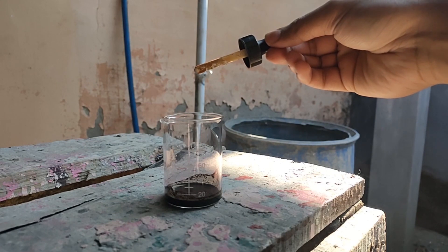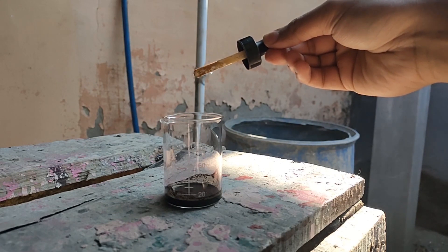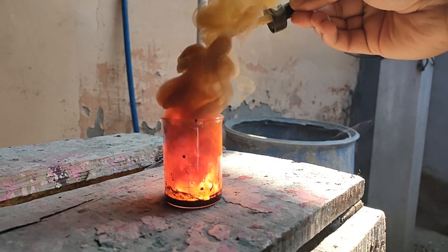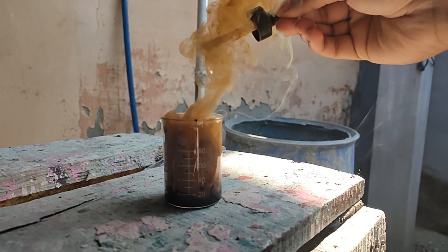As soon as the drop of alcohol falls into the mixture, the mixture explodes — and the explosion is extremely beautiful to watch.